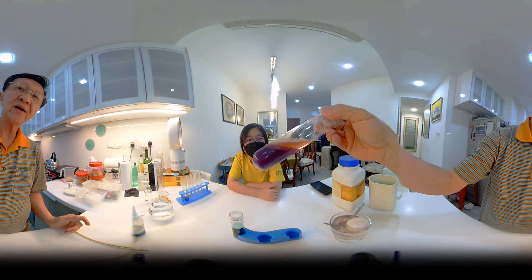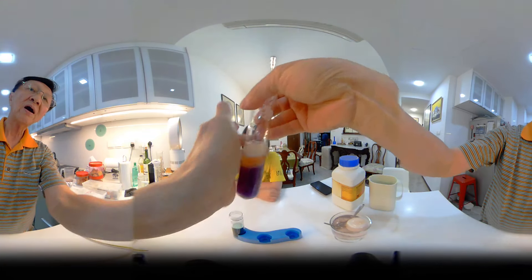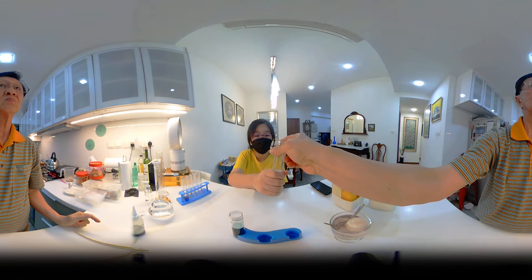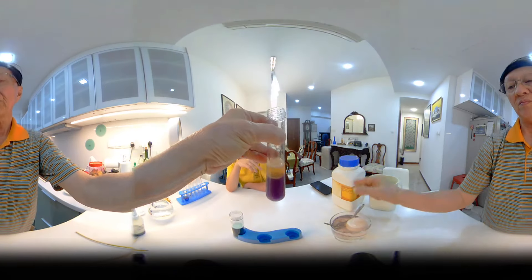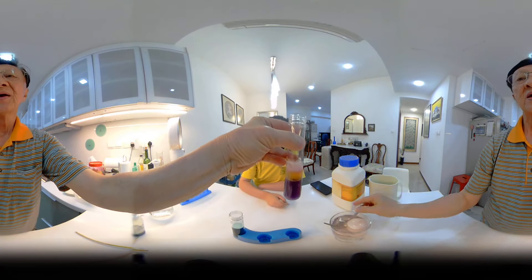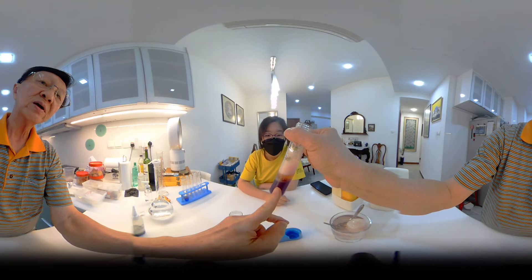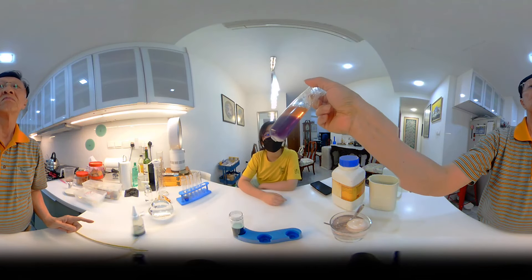You will find that there is a little bit of yellow. Can you feel the plastic test tube? What do you feel? A little bit warm. Therefore, you can see that there is a neutralization going on between the weak acid and the weak alkaline, with the evolution of carbon dioxide.